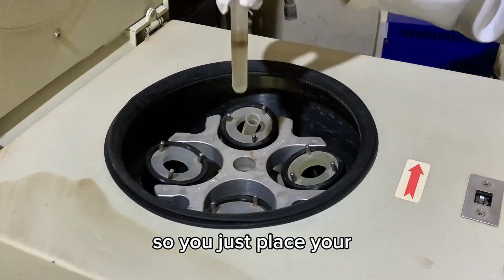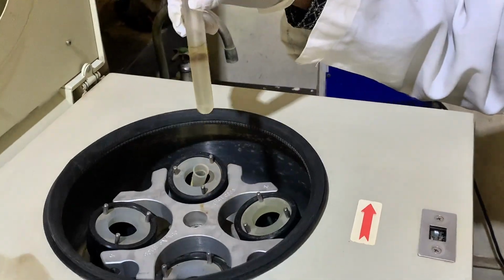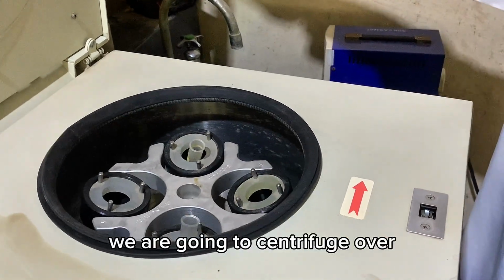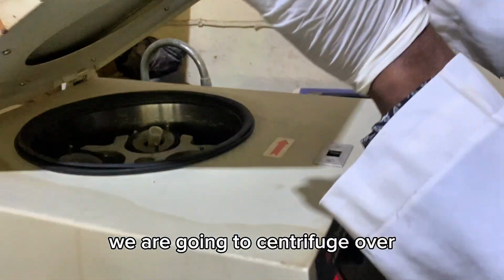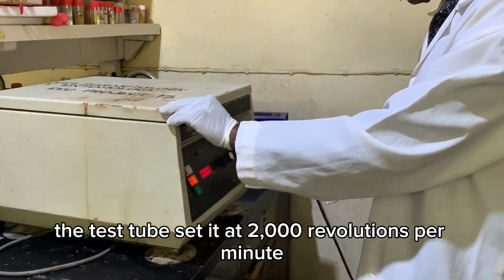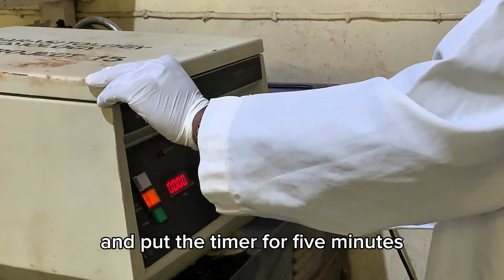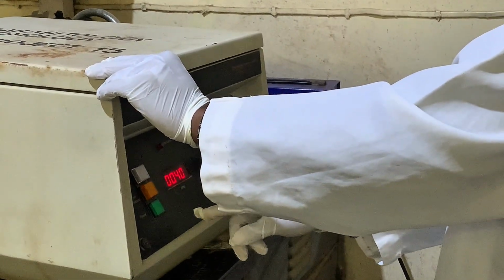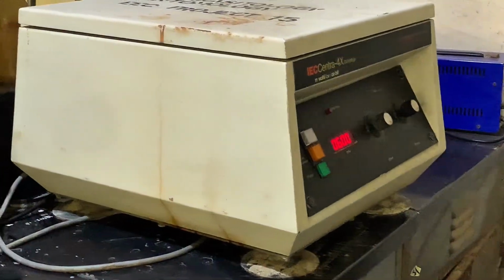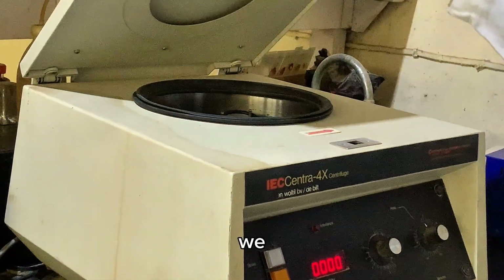So you just place your test tube. Make sure you have one that balances the one we're going to centrifuge. Cover the test tube, set it at 2000 revolutions per minute, and put the timer for 5 minutes. So it's 5 minutes now, and we are through with centrifugation.